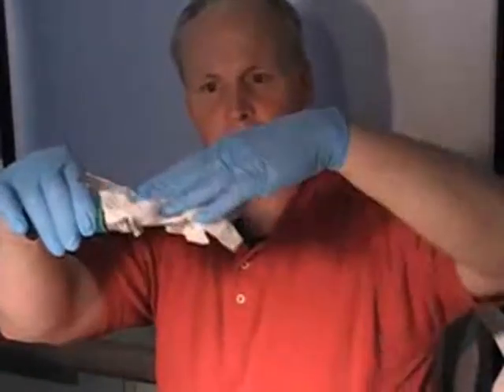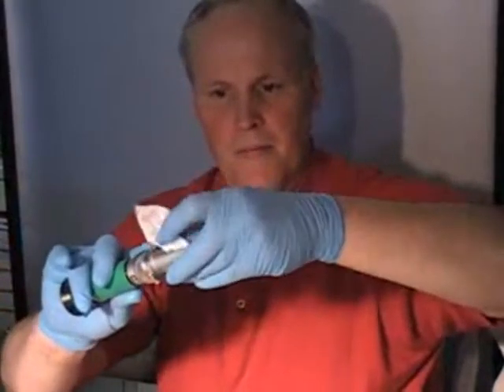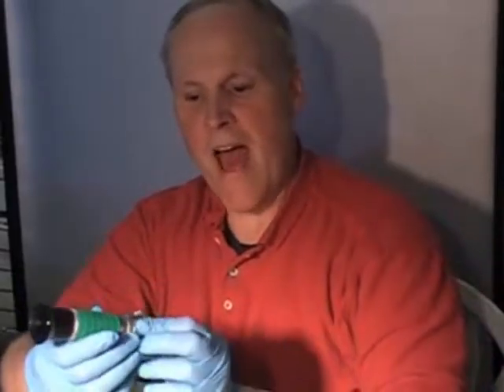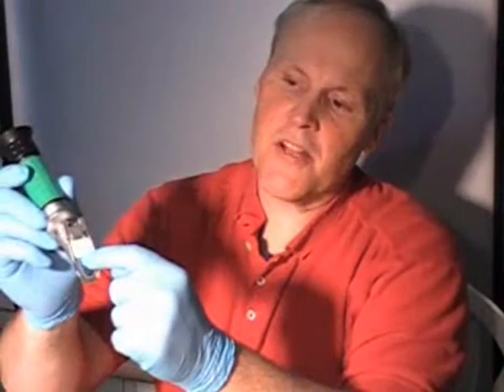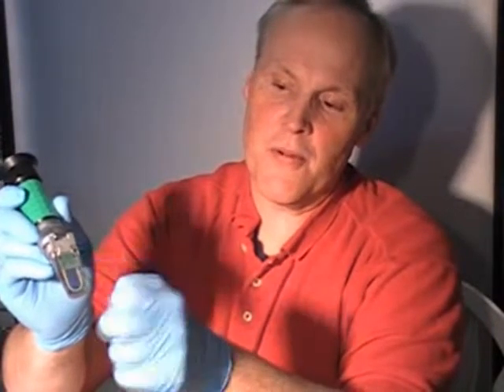The next thing you're going to do is wipe that water off, just like this. One thing I should mention — there's a little tag here that says BTX1. It sits up top, and since there's enough light being allowed in below the tag I'm not going to take it off right now, but you really should take that tag off. It might be down further on yours and you might not get enough light in to get a good reading. So when you get it, just take that tag off.